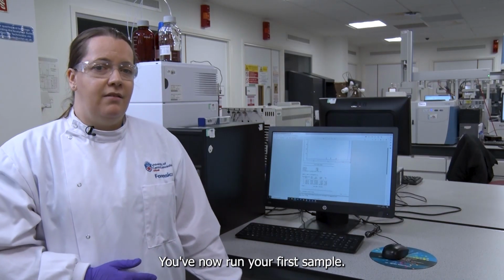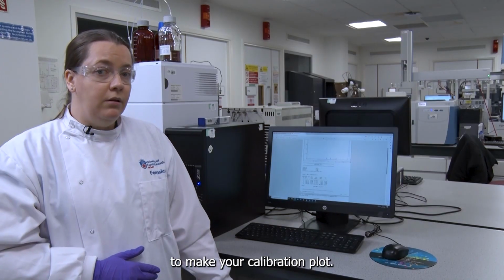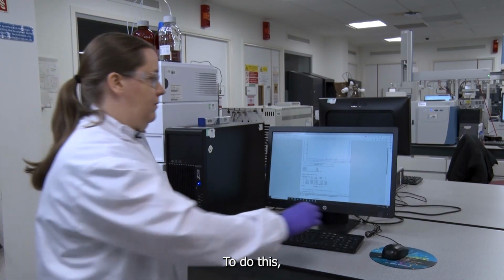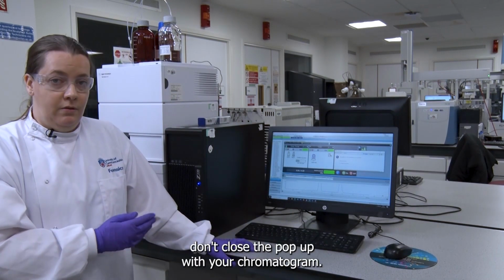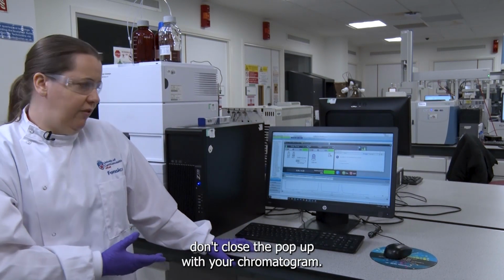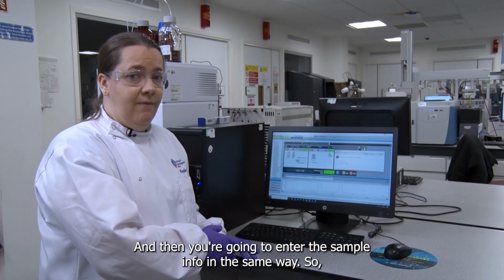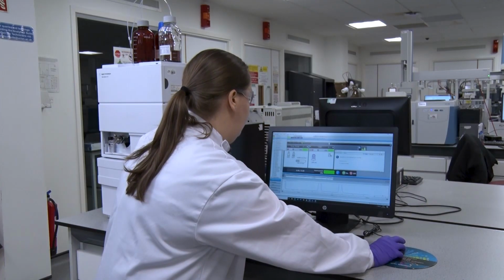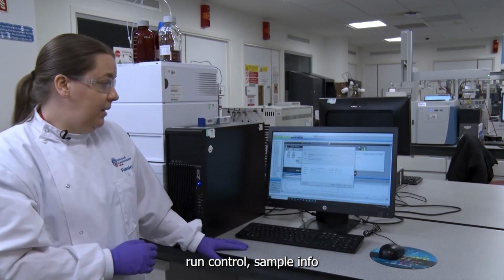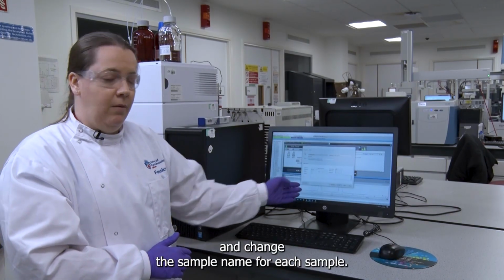You've now run your first sample, so now you're going to run the rest of your samples to make your calibration plot. To do this, minimise, don't close the pop-up with your chromatogram, and then you're going to enter the sample info in the same way. So Run Control, Sample Info, and change the sample name for each sample.